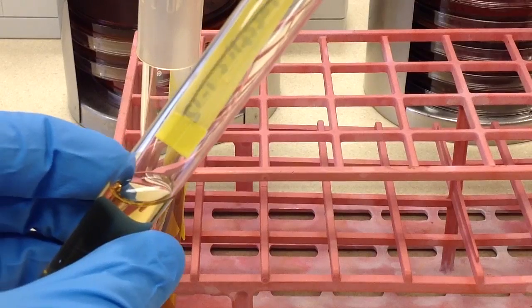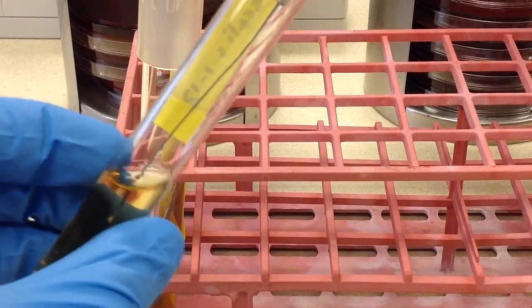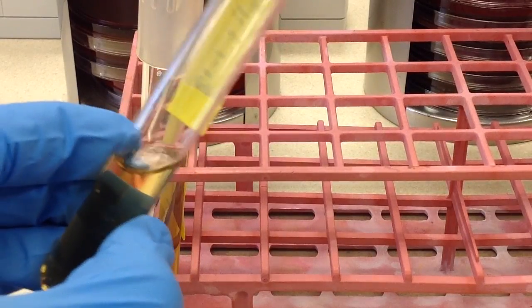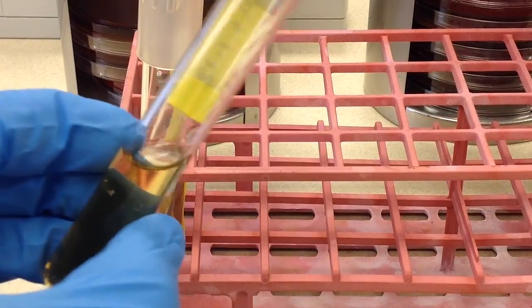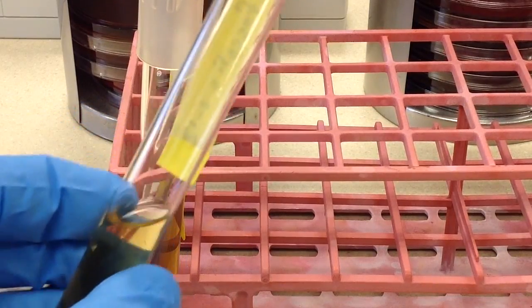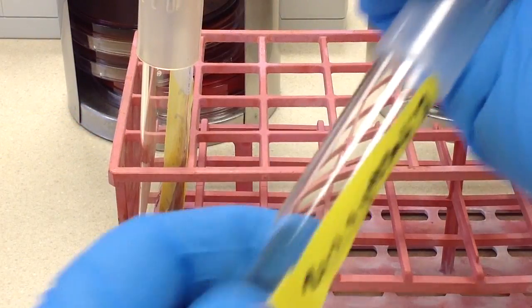Taking the cap off, and then just lowering the needle into there, and you can just swirl it around. And that's it.